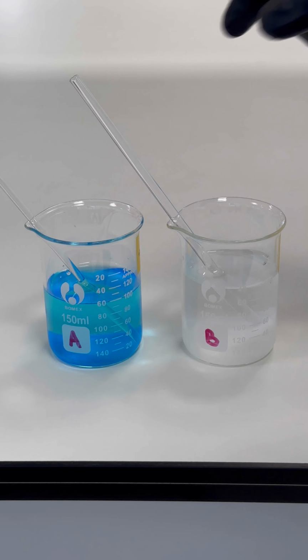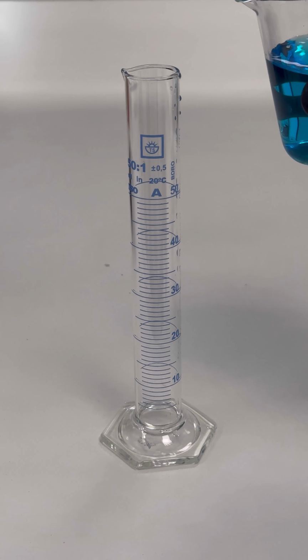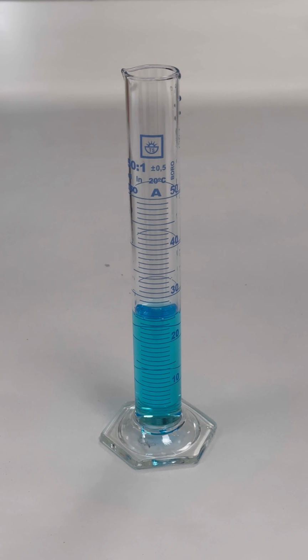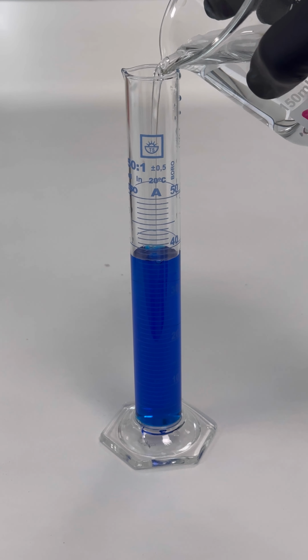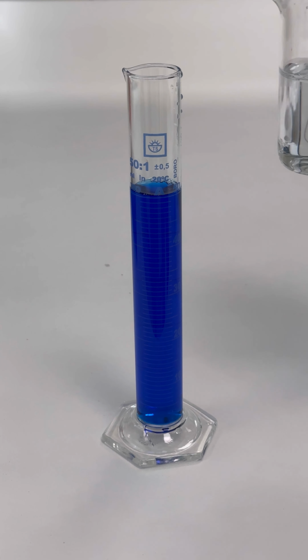Stirring these solutions results in 2 clear liquids. Fehling's reagent is prepared just before use by mixing equal volumes of solutions A and B, resulting in the formation of a dark blue tartrate complex of copper. The coordination chemistry involved is complex, with various species having different metal-to-ligand ratios.